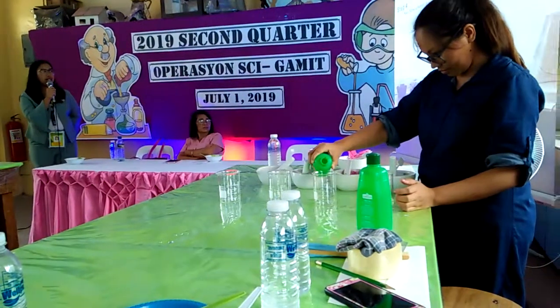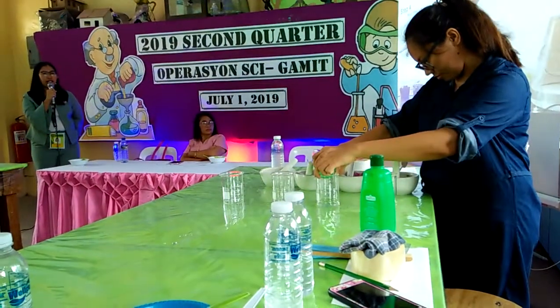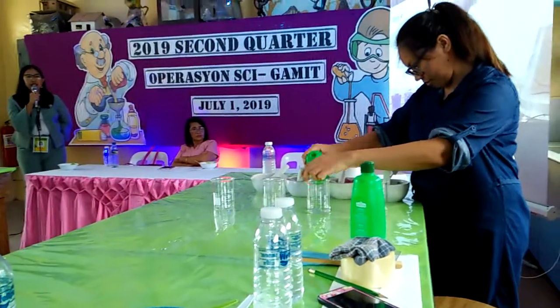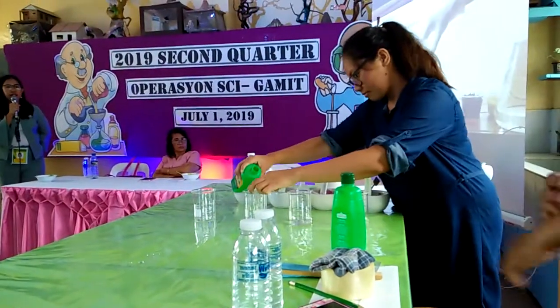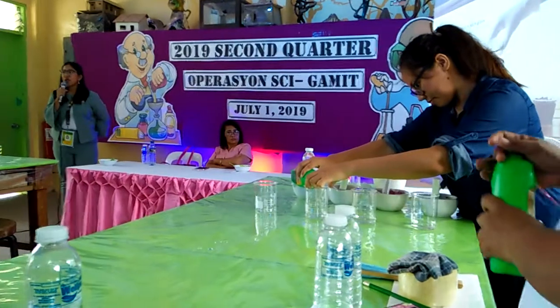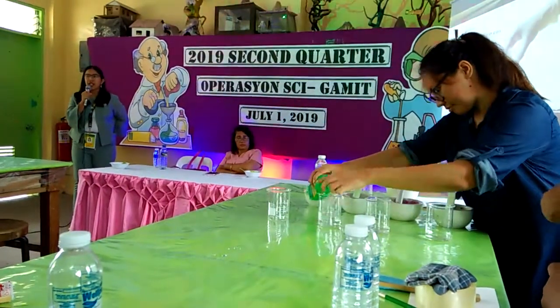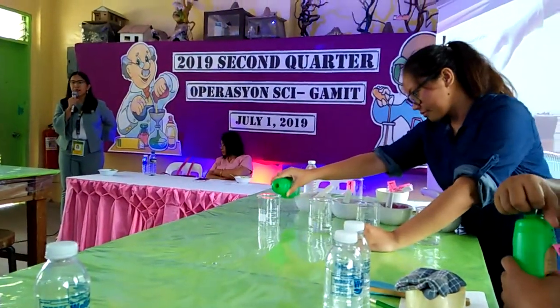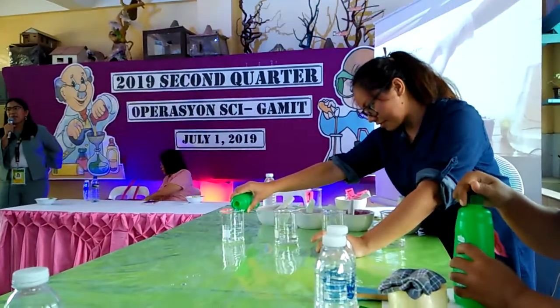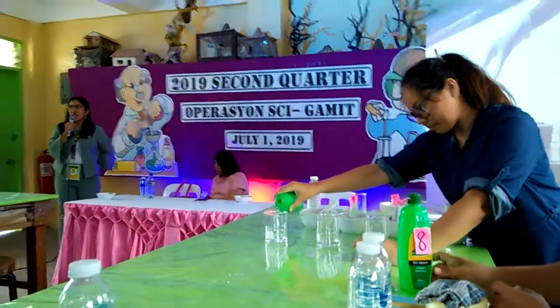Step four: you're going to pour the isopropyl alcohol in each glass. Ma'am Jelly is doing it, pouring into the beakers. Later on, so that the participants can try out.